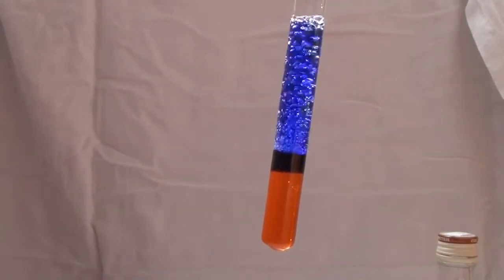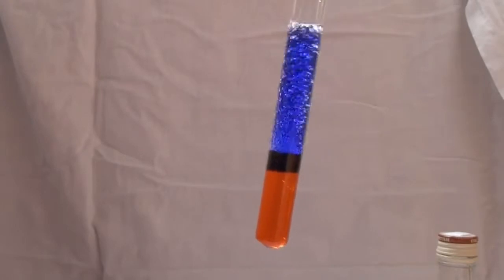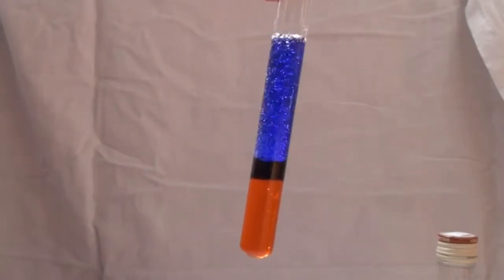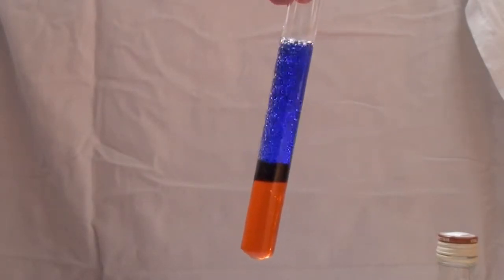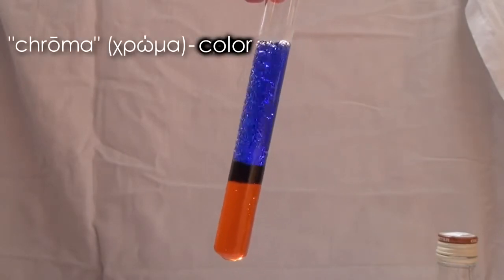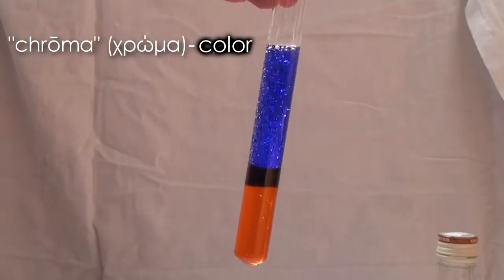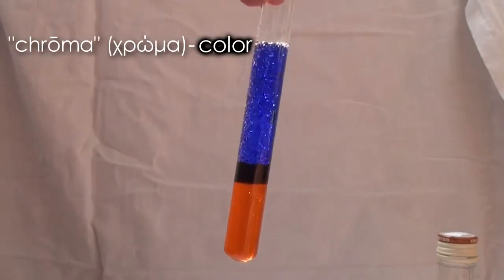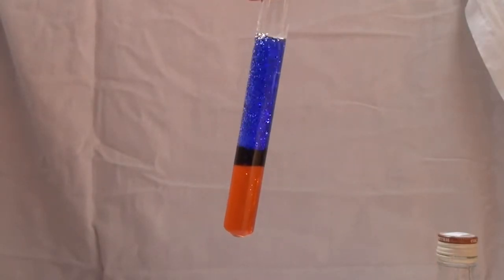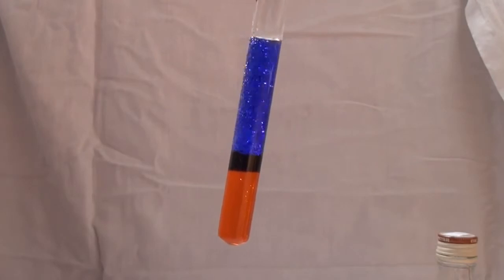This experiment demonstrates interesting properties of chromium. The name 'chrome' comes from the Greek word 'chroma', which means color. Such a name was chosen because different chromium compounds, depending on the degree of oxidation, can have almost all colors of the rainbow.